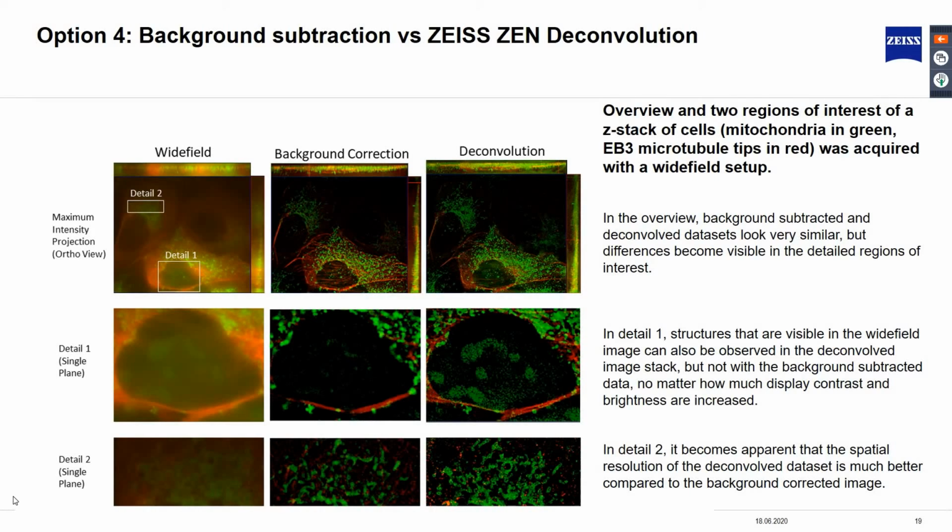However, the differences become obvious in the detailed region of interest. When we look at the detail in region 1, structures that are visible in the widefield image can also be observed in the deconvolved image stack. But these structures are completely removed in the background subtracted dataset, no matter how much display contrast and brightness are increased. This shows that deblurring methods such as background subtraction and other similar techniques will erode weak signals and completely remove the signals during background correction, resulting in the loss of information.